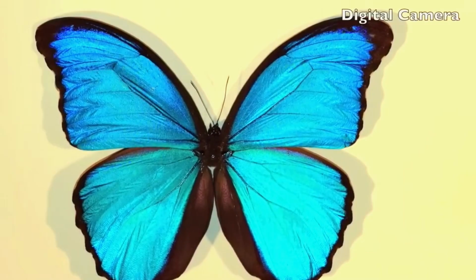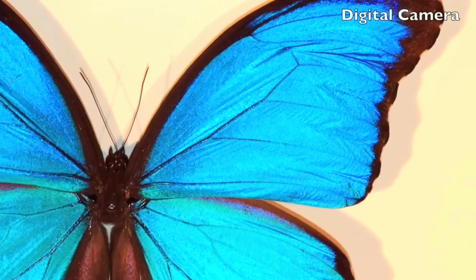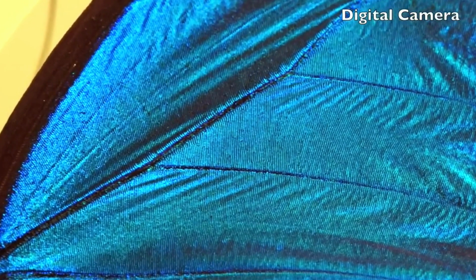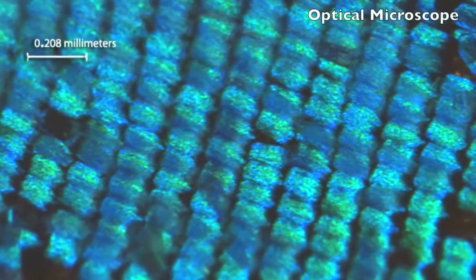Let's, for example, look at the wing of this butterfly. It has amazing light refraction. It has little traps on every cell of its wing, which absorb the yellow light from all the light received by the wing, and will therefore emit back only the blue light. Therefore, the wings of the butterfly always look beautiful, bright blue, although in reality they're not blue in color.